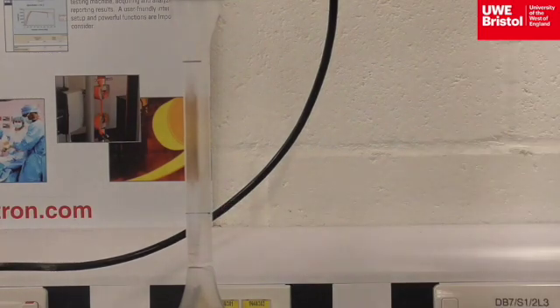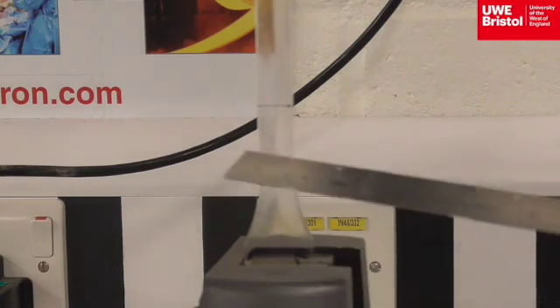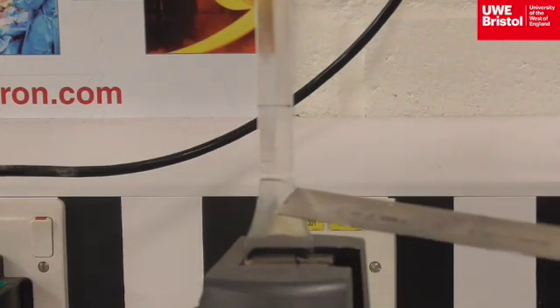Here, the specimen has fractured in this location, and zooming in, displays horizontal lines in the polymer. These are fracture lines and referred to as crazing lines.